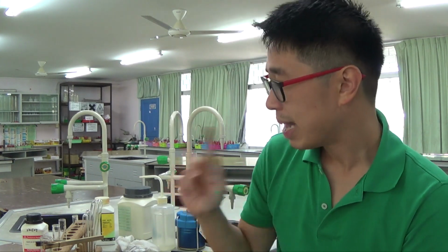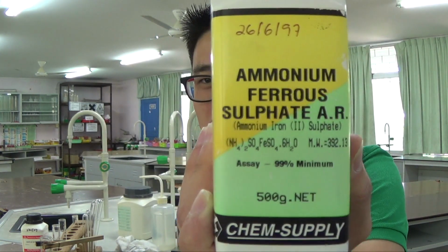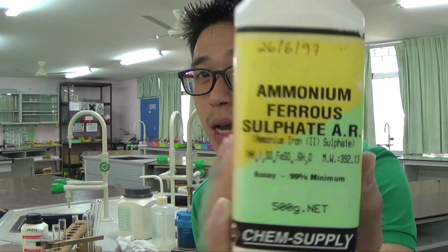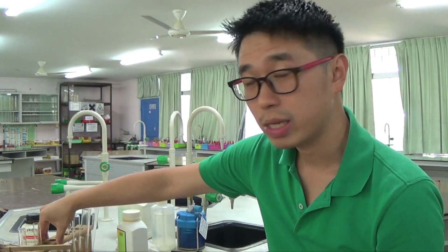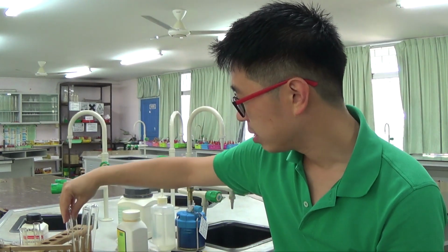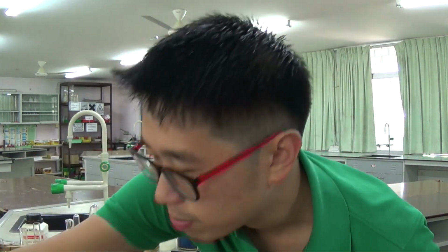Okay? Last but not least, I just want to cover this thing which was really complicated, but actually it's not that complicated. It's the double salt I talked about earlier. It's got 2 salts, ammonium sulfate as well as iron 2 sulfate. So you're testing for 2 cations here, by the way, and it's a bit colored. So let's grab a new spatula.